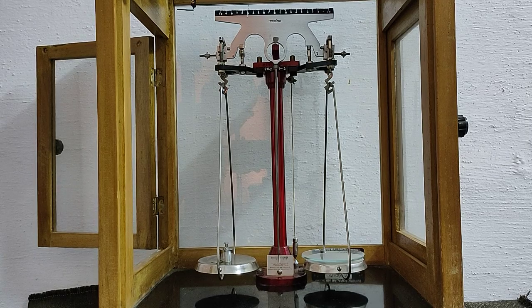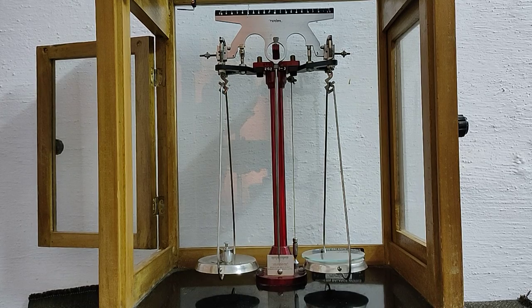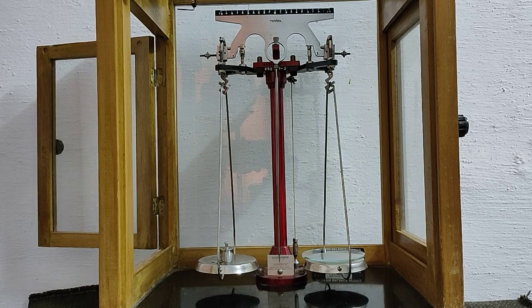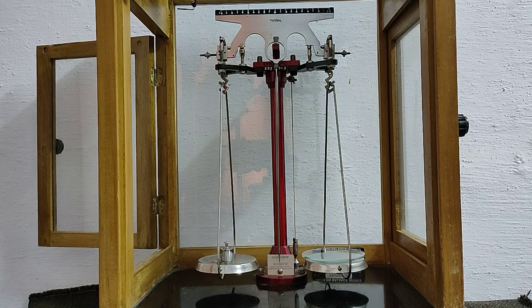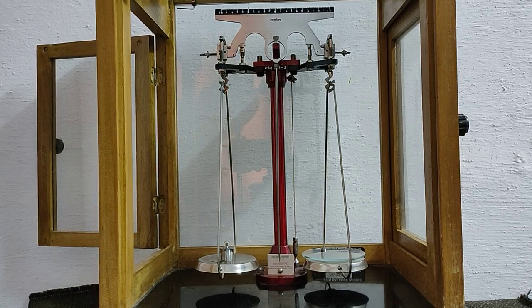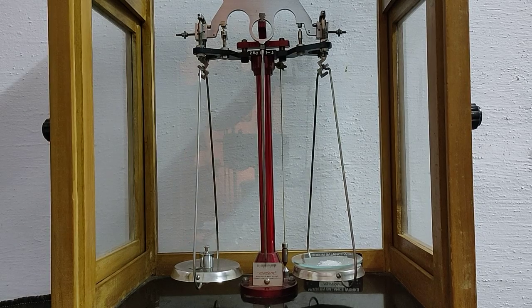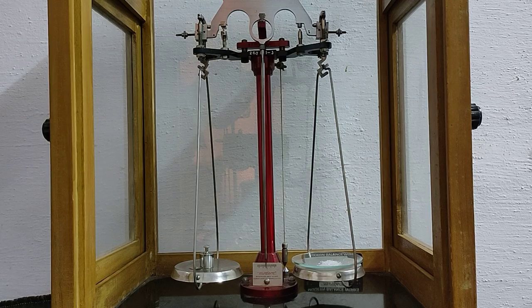We cannot use 10 milligram, less than 10 milligram. That's why we are using rider at 5 that measures 5 milligram. Now we have weighed exact oxalic acid 0.315 gram.